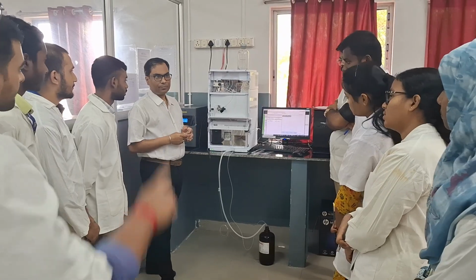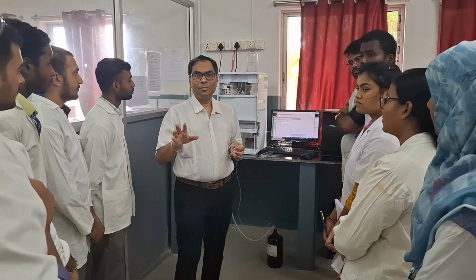Okay, thank you. Sir, one question. Which software is used here for recording?